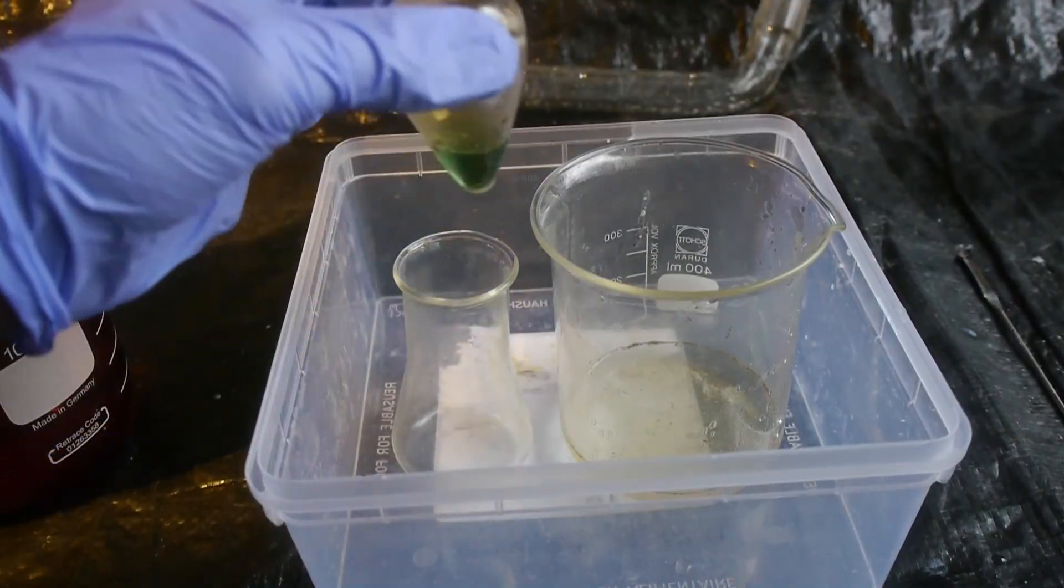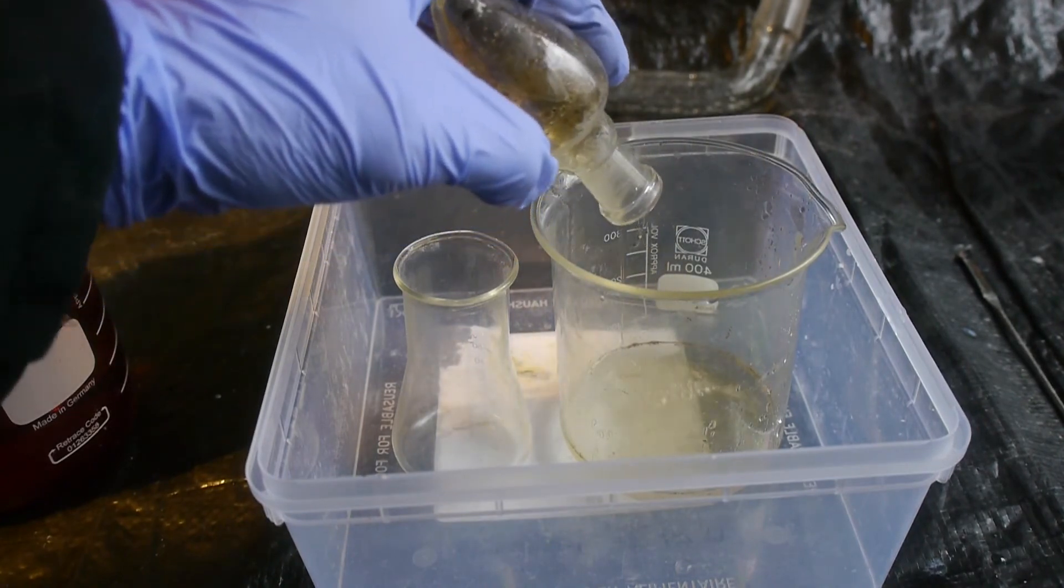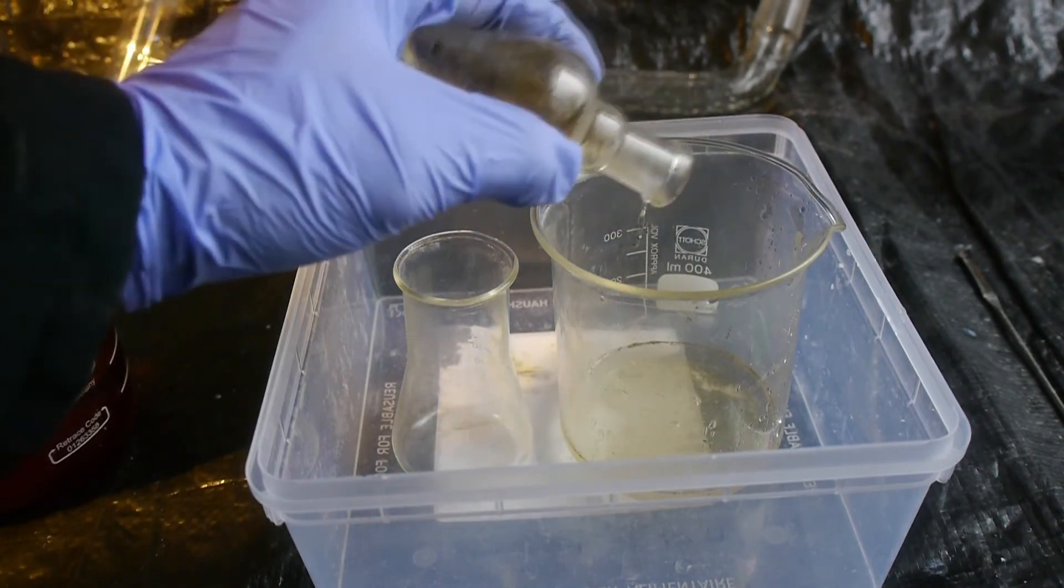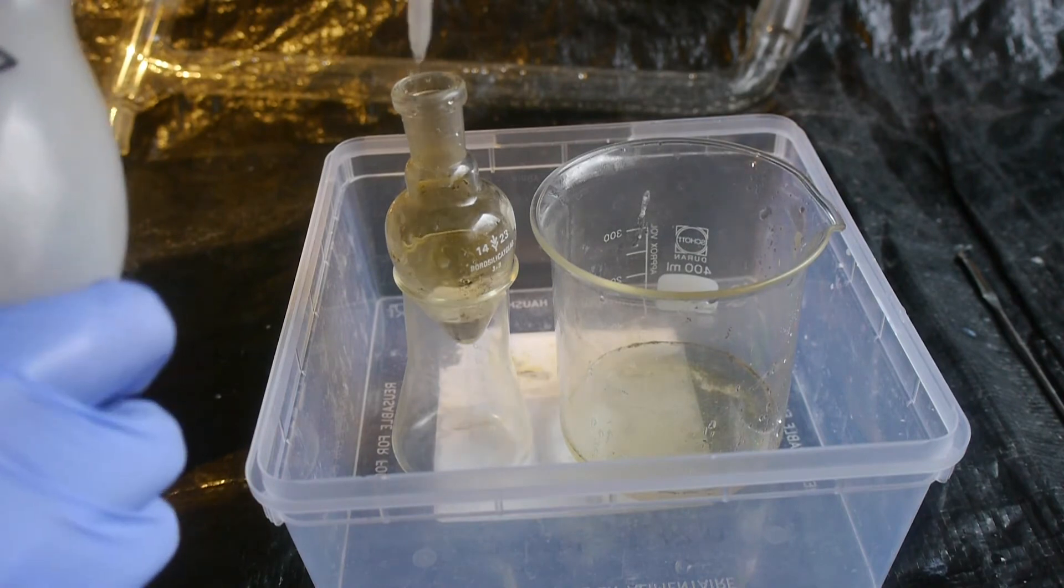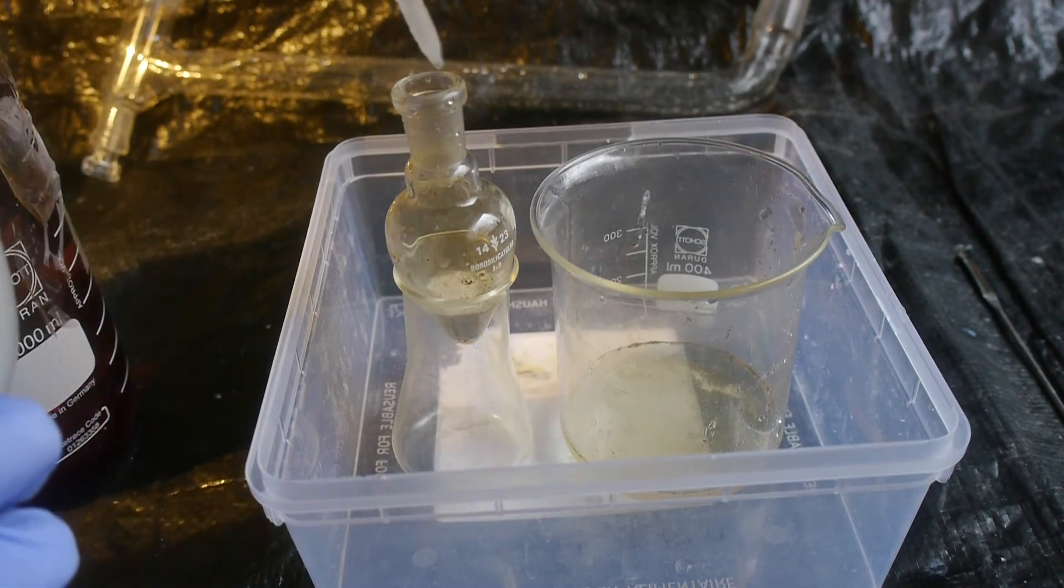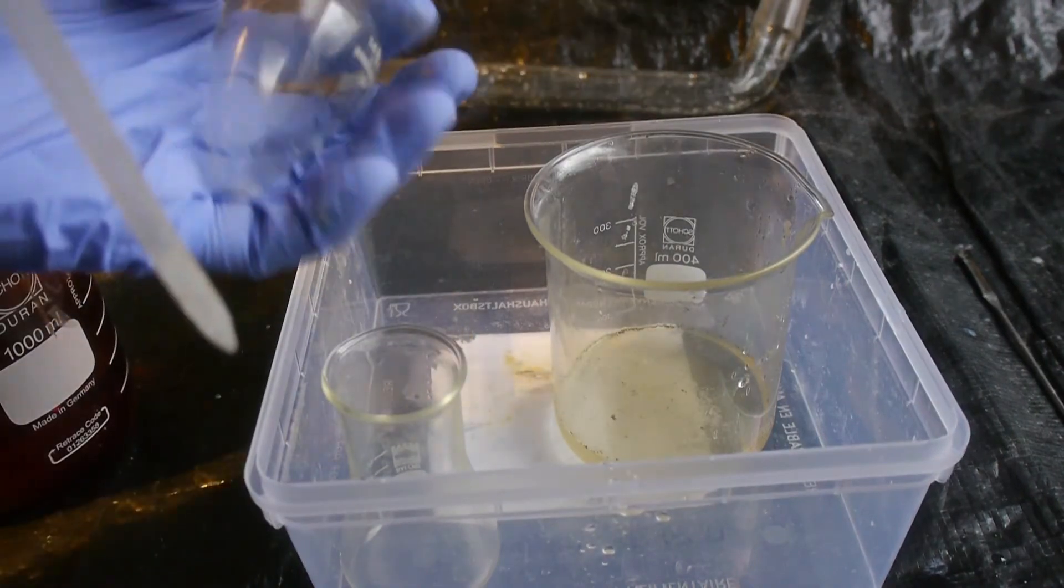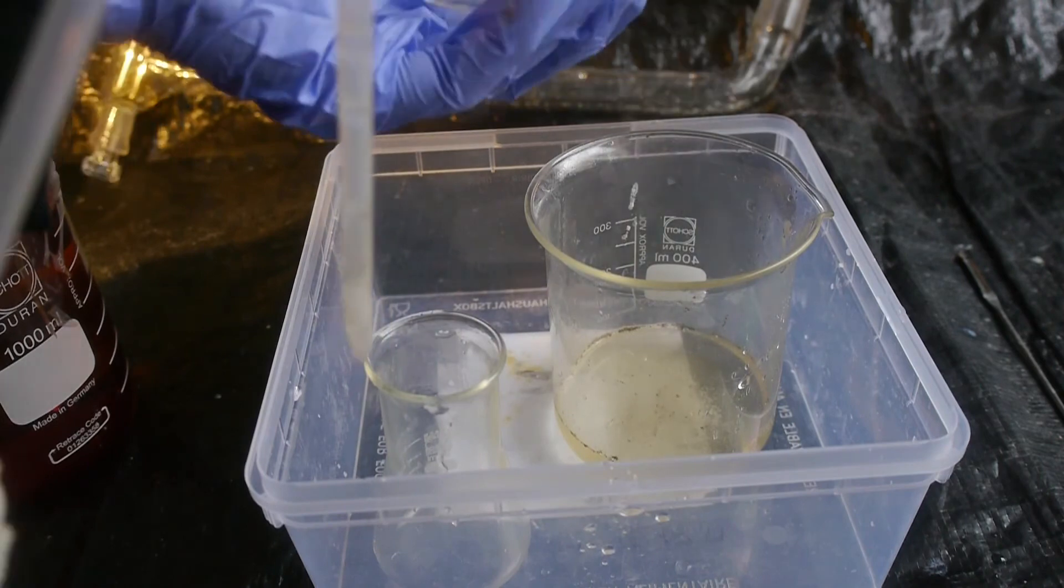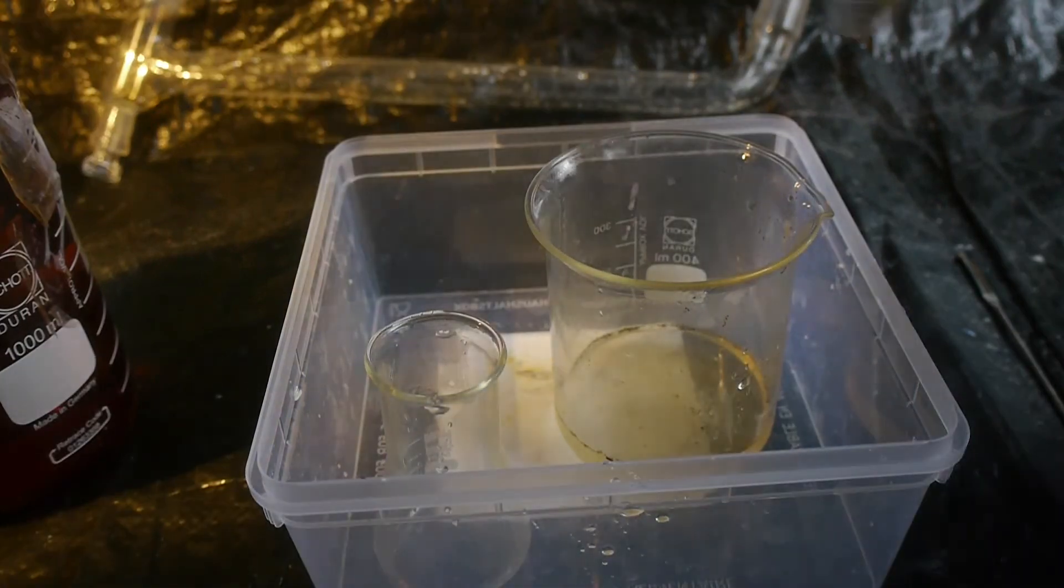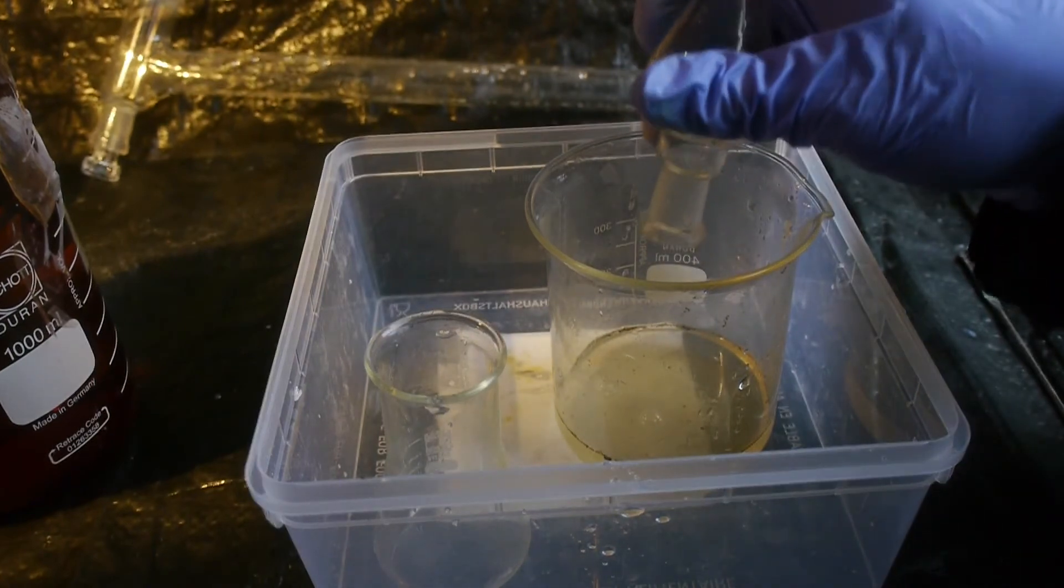Okay, so now seriously all of the residue has dissolved in nitric acid. Meaning that it is impossible, or at least as far as I know impossible, that it contains a useful amount of gold. Because gold is not soluble in nitric acid. I don't know who had the idea that this contains gold. But I've now chemically proven that it doesn't. And I've cleaned up the mercury as a nice side effect. I just need to deal with all the soluble mercury. Which is a lot more dangerous than mercury metal.